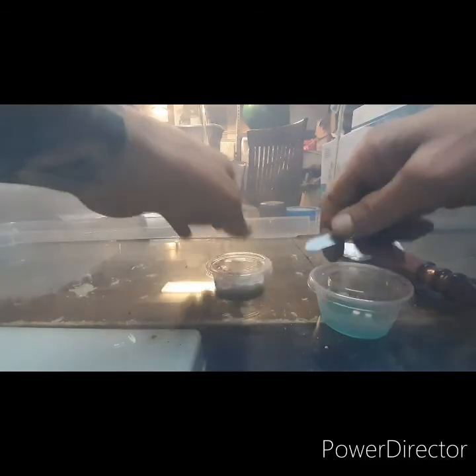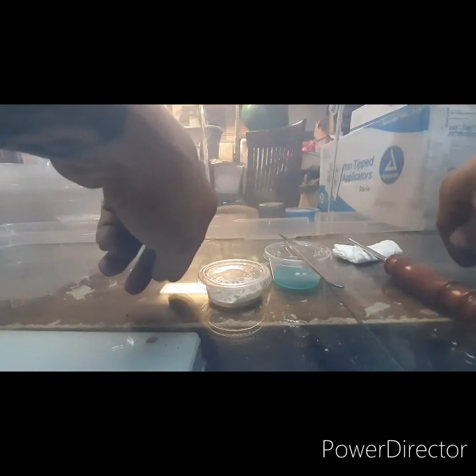That's a video on how to use an agar punch. You guys got lucky — one got stuck so you actually got to see how to get a stuck one out, which like I said doesn't happen very often.